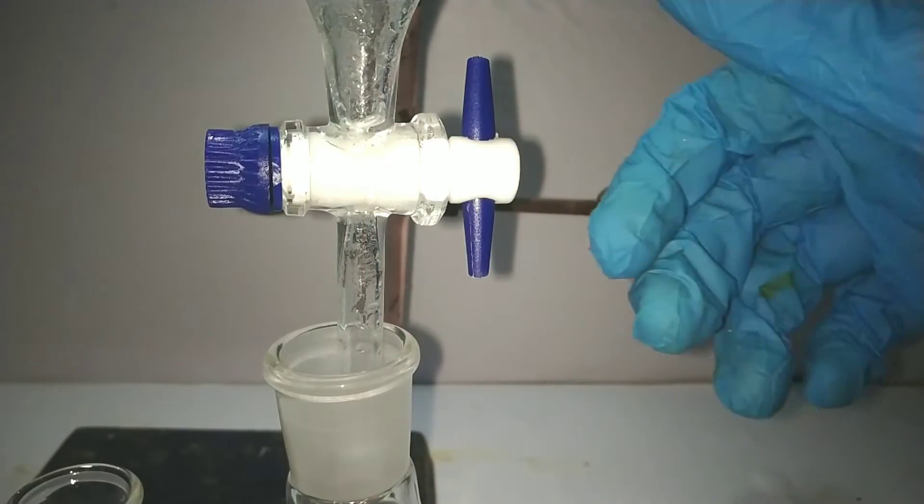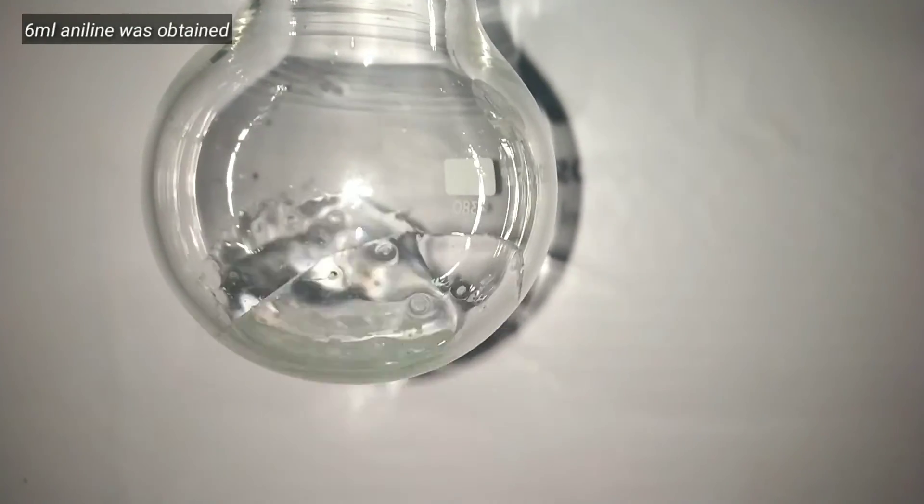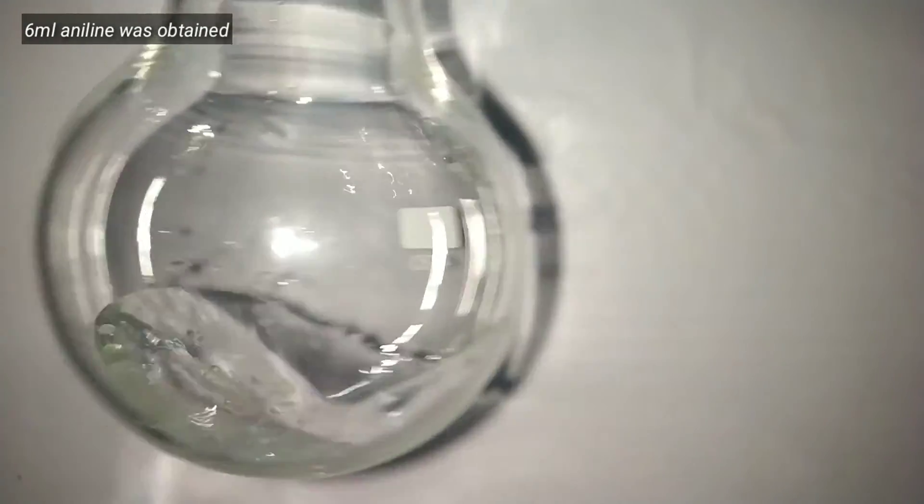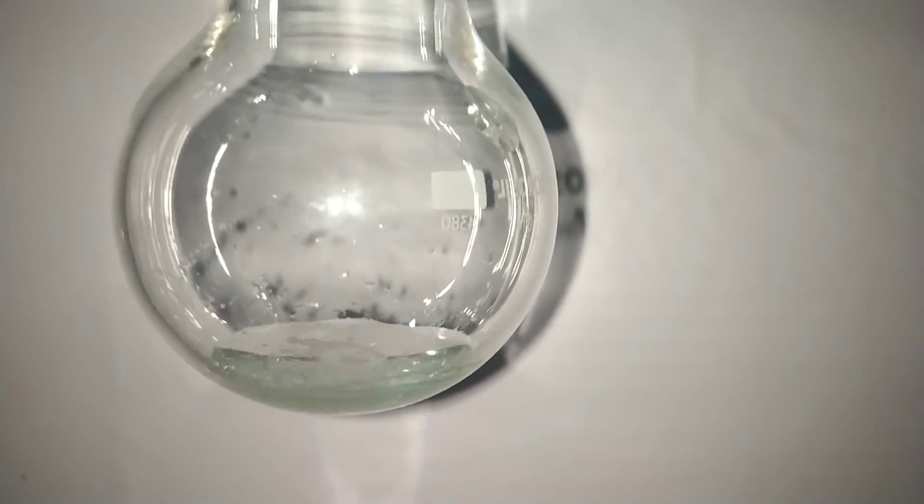And here is the collected aniline. I got a yield of 6 ml which represents 74% of theoretical yield.